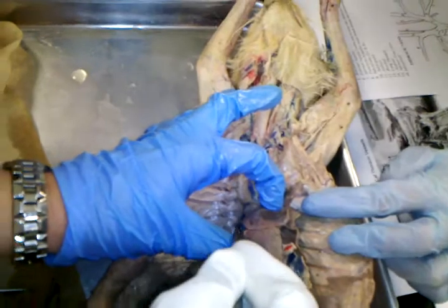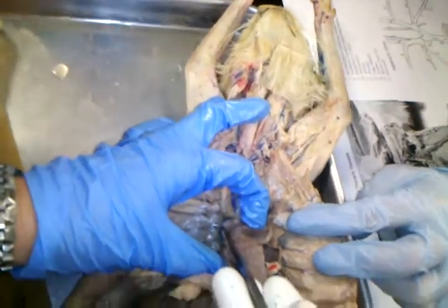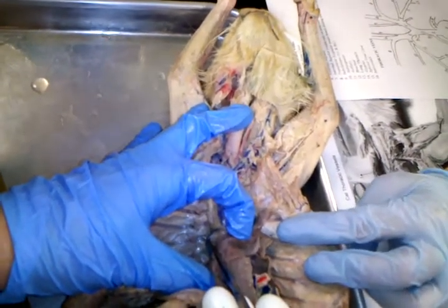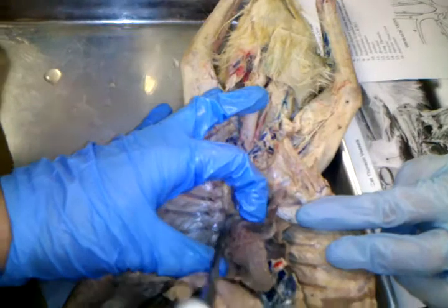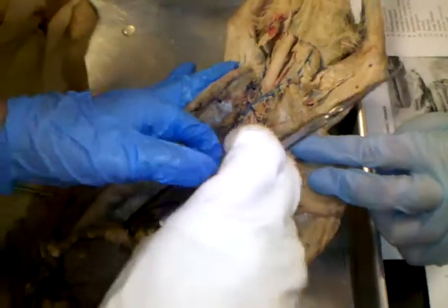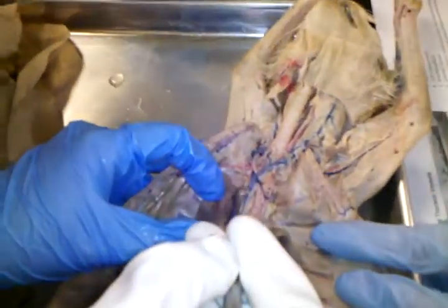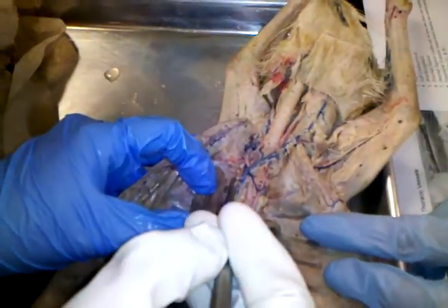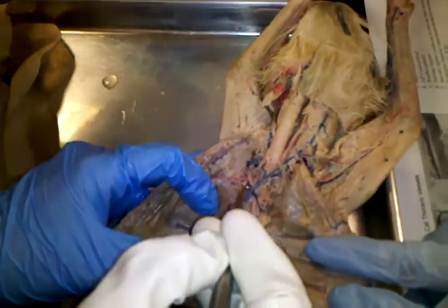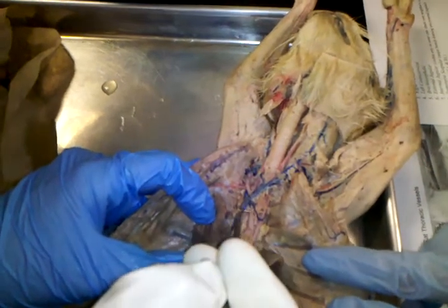See it coming up and dumping in? This one's called the azygos. Don't get that mixed up with the inferior vena cava, okay? Azygos. All right, so we've done 3, but we've got to do a few more. Now, with the veins, it's called the vena cava, superior vena cava, until it branches here and here. I guess stuff was actually branching into it. When it branches here and here, it's called brachiocephalic.